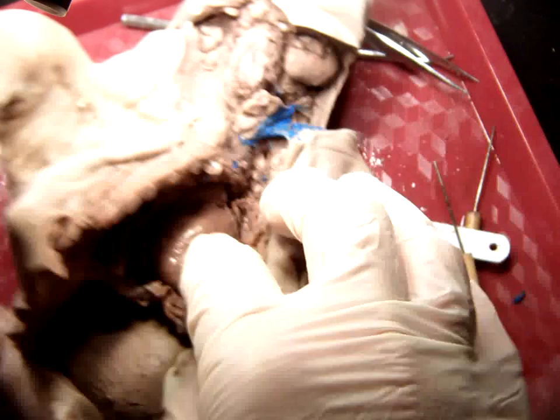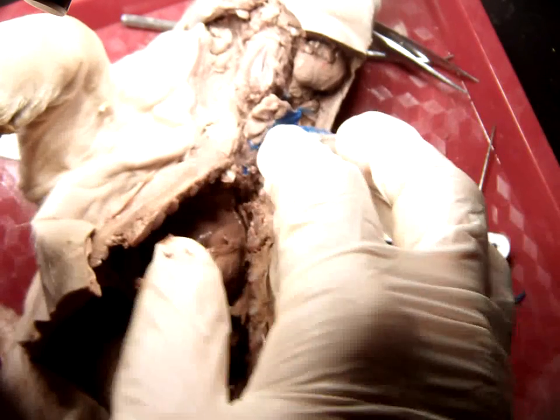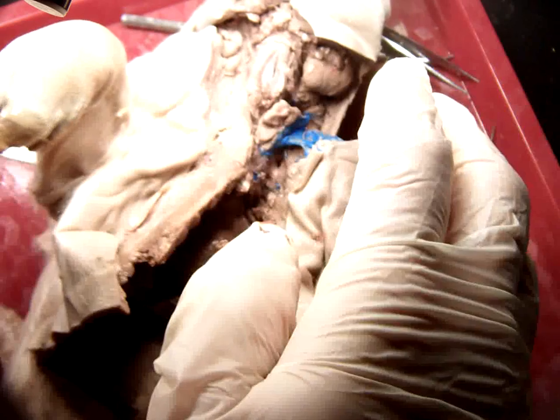Now their chest is slightly different than ours. Ours is kind of flatter and wider because our collarbones, the clavicle, push our shoulders back, whereas four-legged animals have their shoulders all forward and their chest is sort of deep and narrow from side to side.